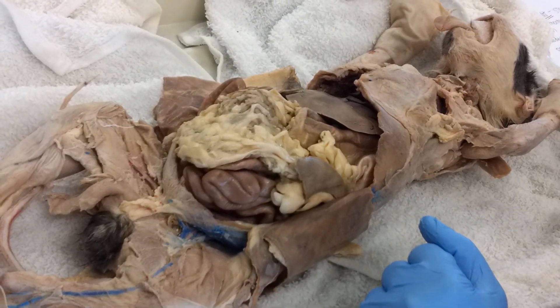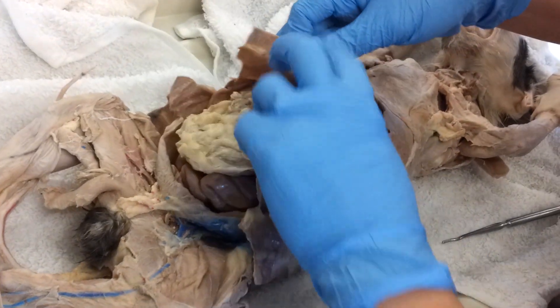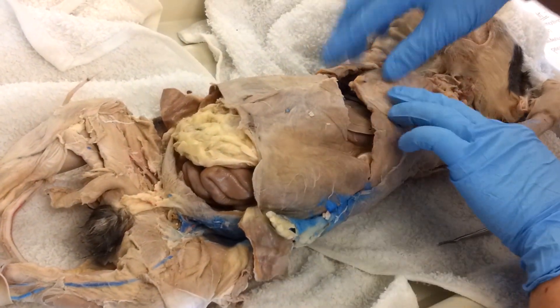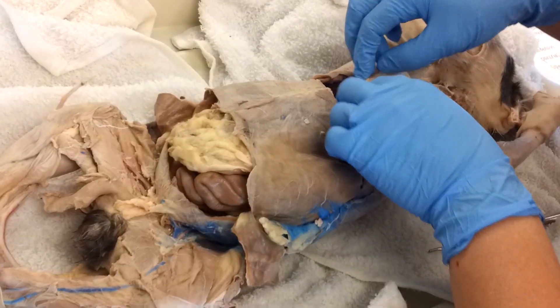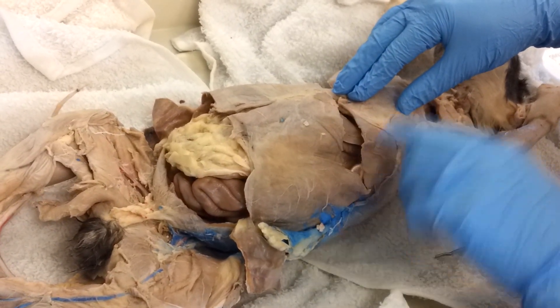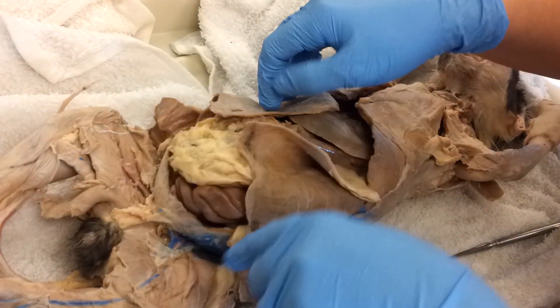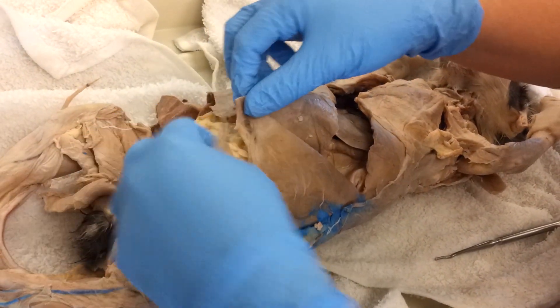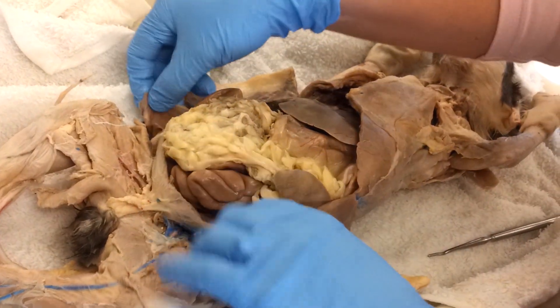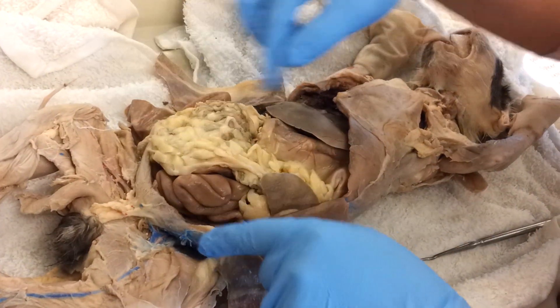We'll go through the internal organs of the cat in this video. This cat has been opened up. What you need to do is take a scalpel and cut right down the middle. When you get up to the bottom of the sternum, which you can feel with your finger, you'll cut with the scalpel this way, or you can use a pair of scissors, and then over this way too. Then go down to the groin — this student cut a little too early, but you'll cut as close to the groin as you can on both sides, and then you can open up the cat like a book. One student noticed it's sort of like the letter I, the way that you make the incision.